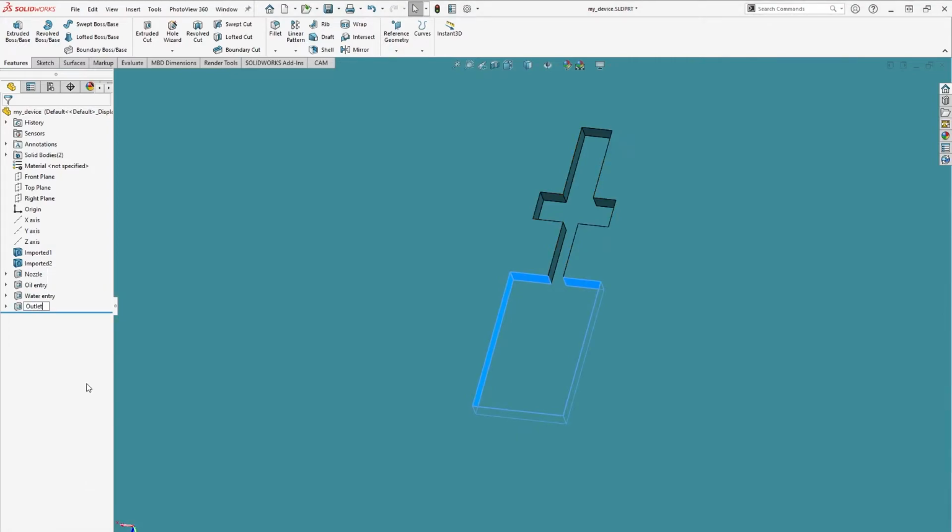Now that the core geometry is in place, we can start to think about how the rest of the device will be laid out. It's important to consider things like inlets and outlets early in the design process to make sure that we can fit into our chosen template. Let's go back to the Parallel website to check out our connector options.